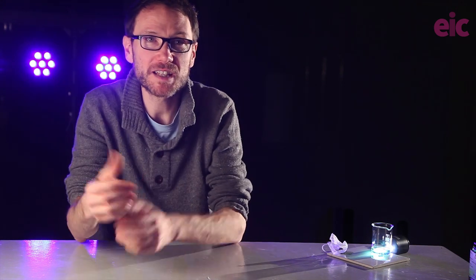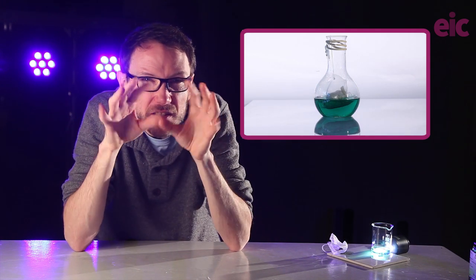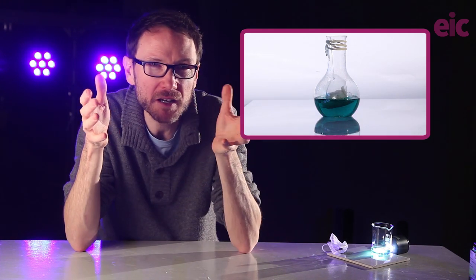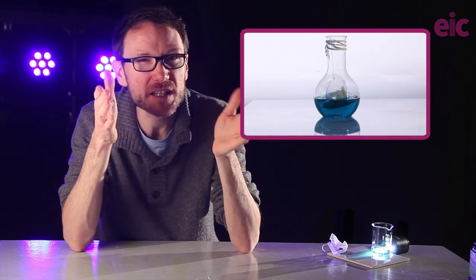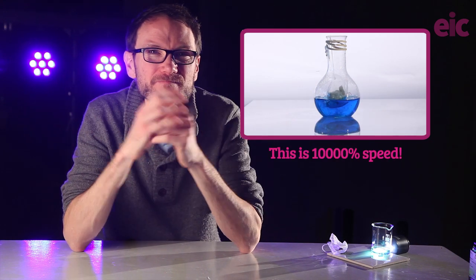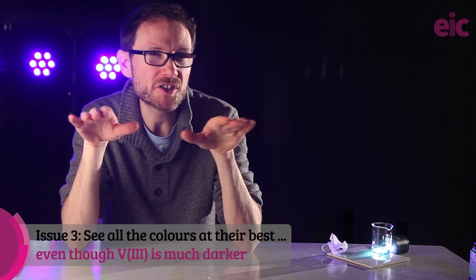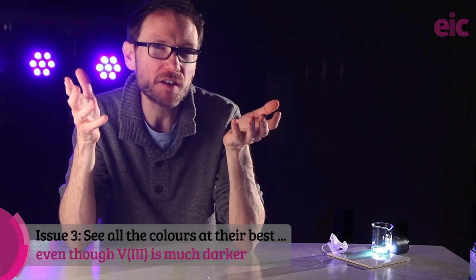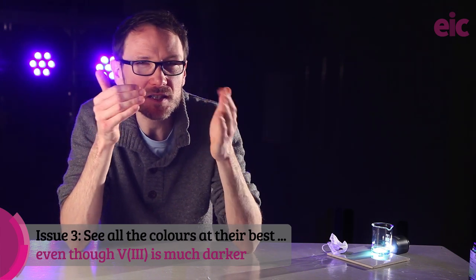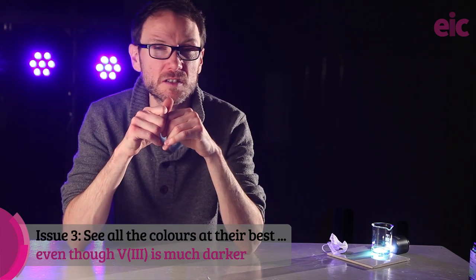So my next thoughts after this were, maybe I could just kind of put the zinc inside some toilet roll, and the toilet roll would hold the powder in the bag long enough for a reaction to take place, but without allowing the zinc to slip through the net. It wasn't great. So I went back to my supercharged zinc granules. While the reaction was still not going fast enough for my liking, I wondered maybe if an oblong-shaped vessel, while I'm still trying to get it going faster, might provide an opportunity for us to view through different path lengths, ensuring that each colour gets its moments to shine.